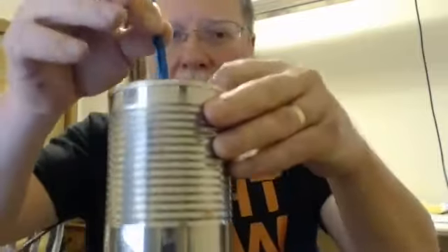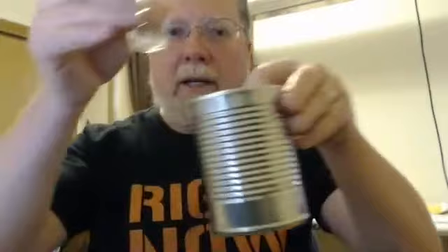At this point, we can take this and dispose of it in the garbage can, like that. You may pour the water off into a sink. There will be a little piece of glass at the bottom that can be tapped down again into the garbage can. Repeat with other samples. Thank you so much, and have some fun.